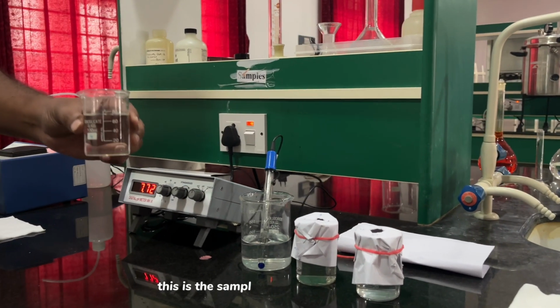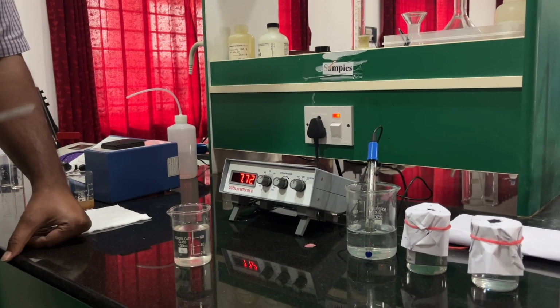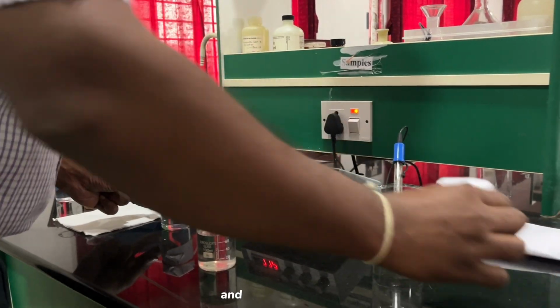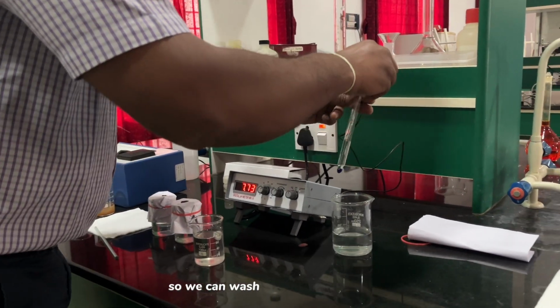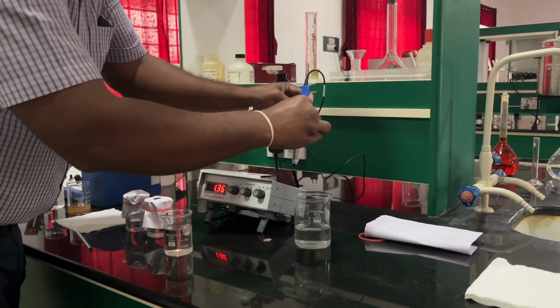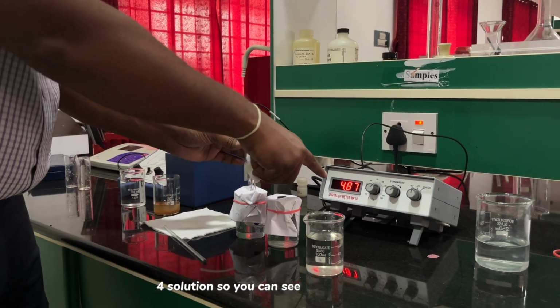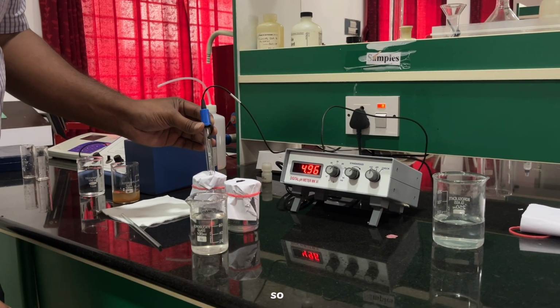This is the sample whose pH we have to identify. Before starting the experiment with the pH meter, let us calibrate it with the pH 4 and pH 9.2 solutions. We wash our electrode knob and wipe it with tissue paper, and let us calibrate the instrument with the pH 4 solution. You can see there is a drastic reduction of pH.